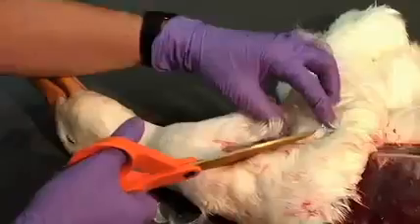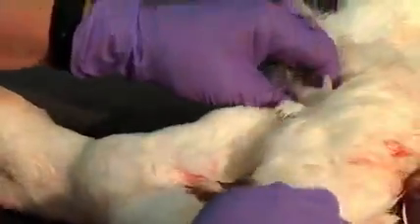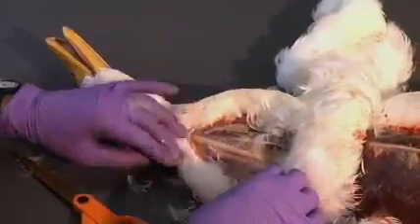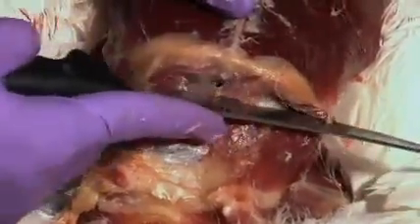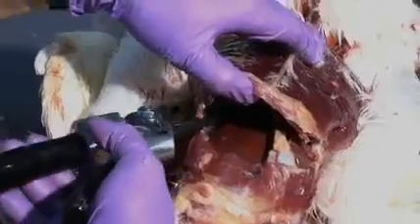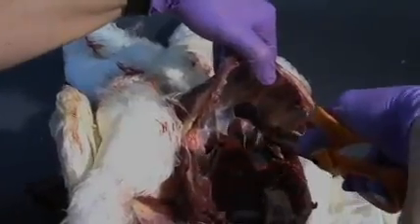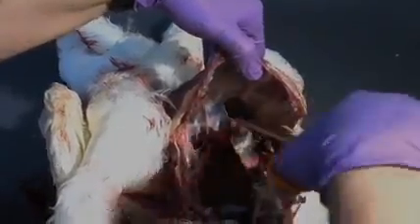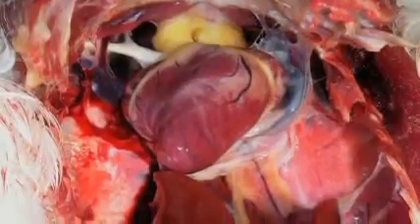To expose the neck region, make an incision in the distal neck and use blunt dissection to separate the skin from the underlying subcutaneous tissue. To open the coelomic cavity, use a knife to cut the body wall along the bottom edge of the sternum. Cut the ribs up both sides of the keel and free up any internal soft tissue attachments. Gently lift the keel and do an initial inspection of the organs.